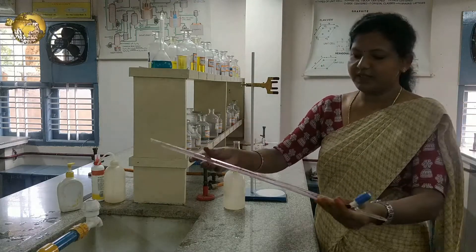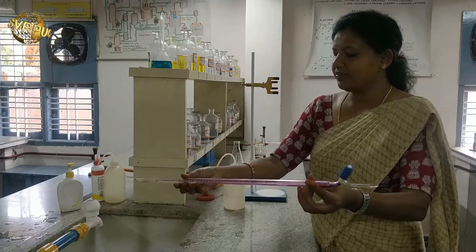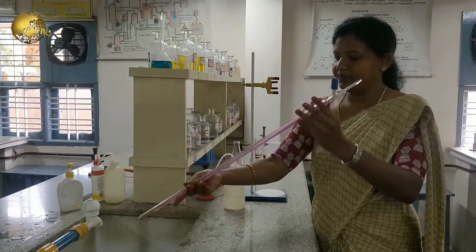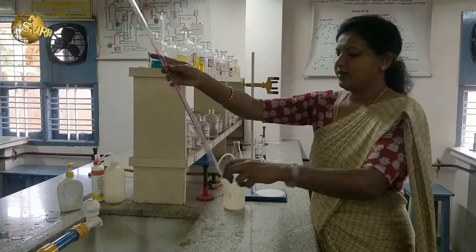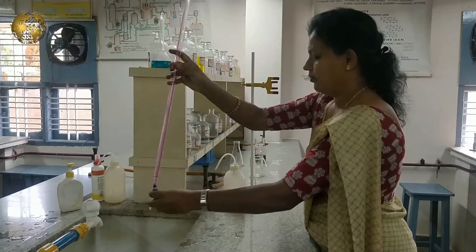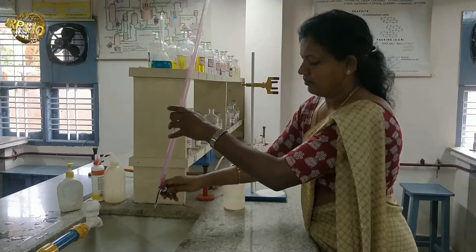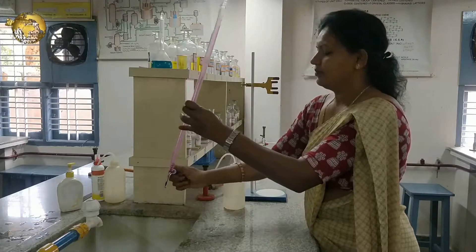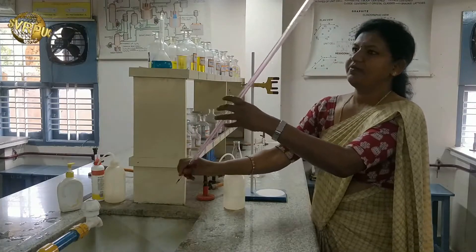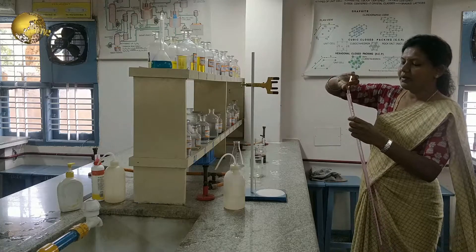When we are rinsing with the potassium permanganate solution, whatever moisture is present inside the burette will dry off. Now I am filling the burette using a funnel with potassium permanganate solution.